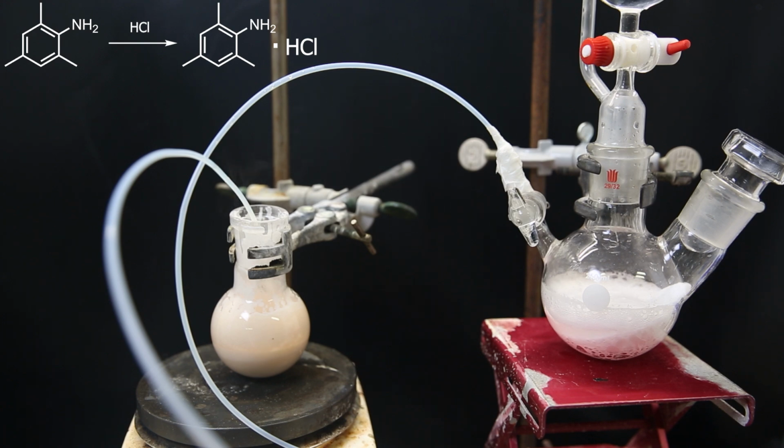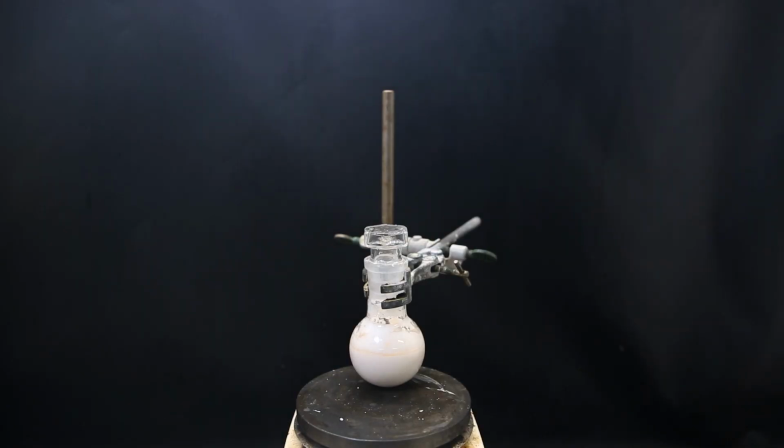The tubing is a small PTFE tube that I secured loosely with some parafilm. Any overpressure would just push up the tubing slightly and vent out of the gas connection through the parafilm. I just let it run for a while, and when it seemed like no more precipitate was forming, I stopped the reaction. It's probably possible to just skip the previous distillation step and form the salt right away, but I haven't tested it.